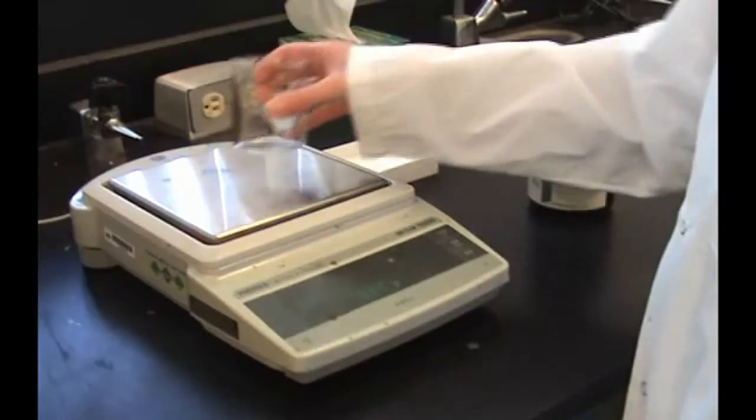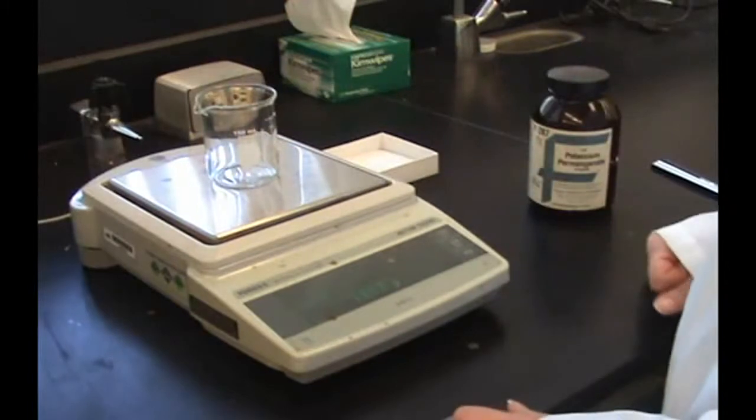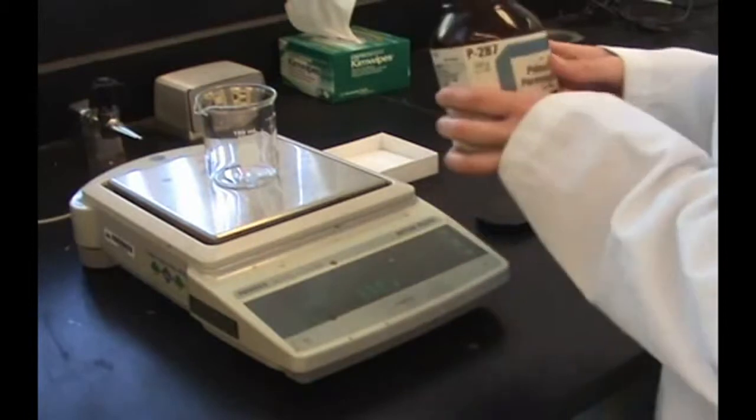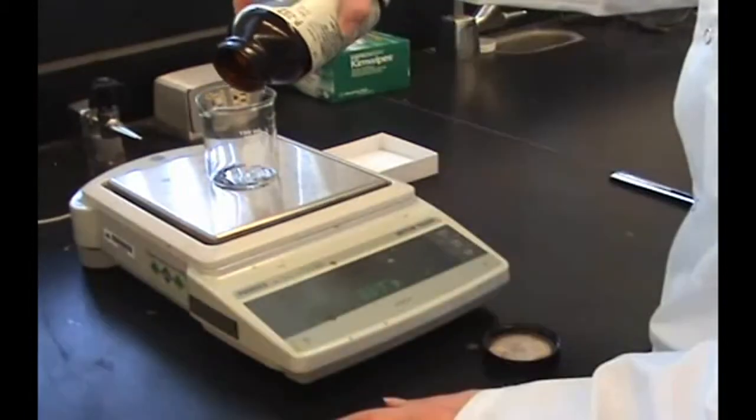Weigh the approximate mass calculated on a top loading balance. Tare a clean dry beaker and slowly roll or tap some crystals into it.